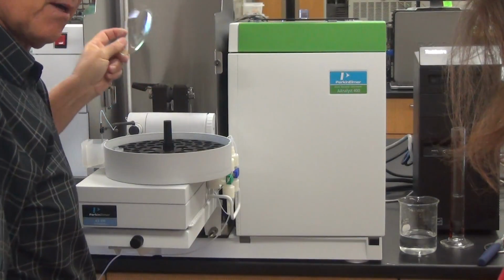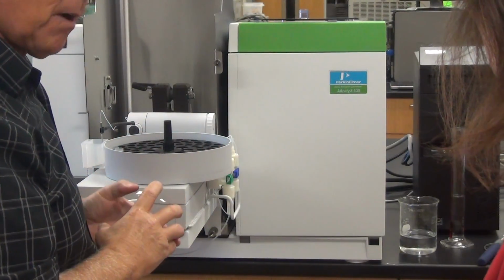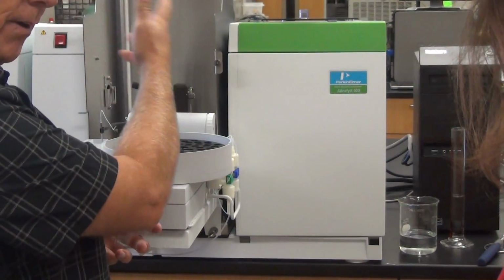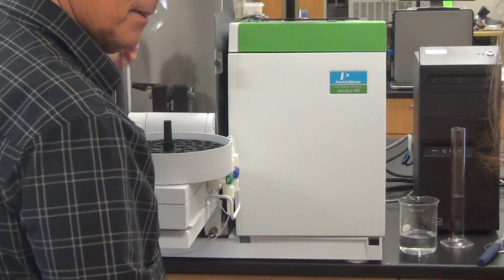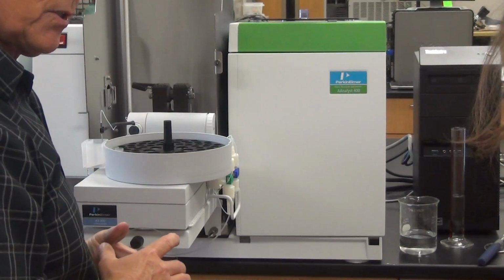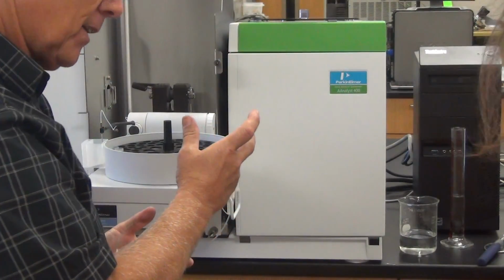So we have a 2-step dry, because dry is very critical. And you know, if I'm 20 degrees too high, it'll splatter everywhere. If I'm 20 degrees too low, and it's all relative to your incoming voltage, it's not going to dry right. So we're on our way up to 130, and it's dry. So that's why we go 110, just above the boiling point. And then we want to make sure it's nice and dry before we go up, because graphite's porous.